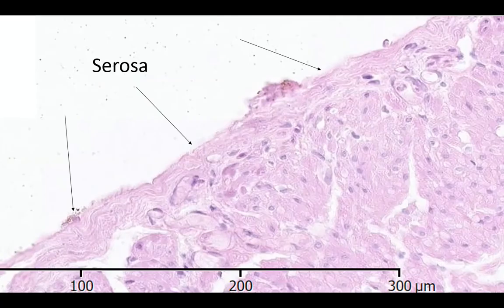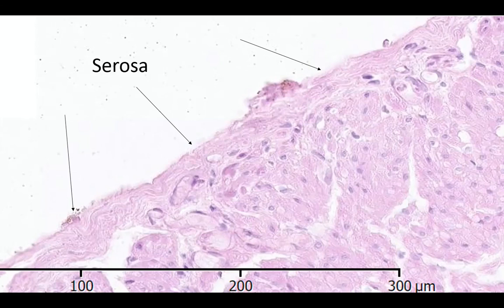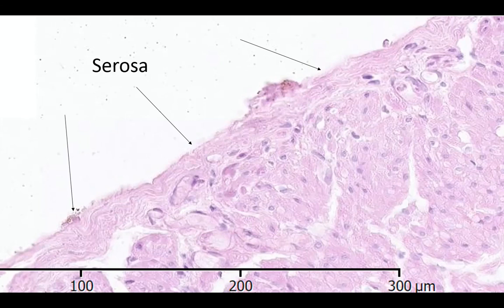Now we are moving on to the last and final layer of the appendix cross-section, which is the serosa, as highlighted with the arrows. This layer contains loose connective tissues, nerves, and vasculature covered with a thin layer of mesothelial cells, which are not easy to see here.